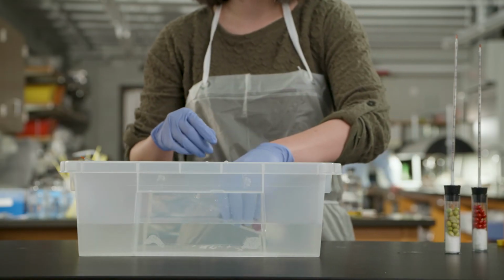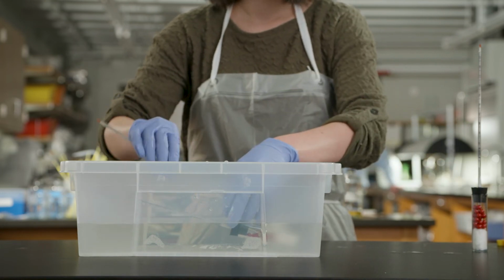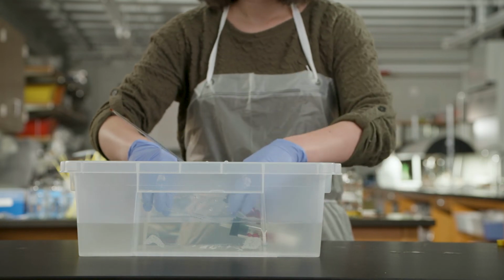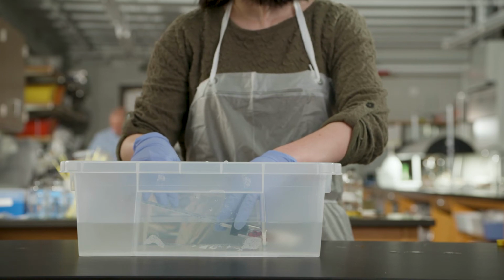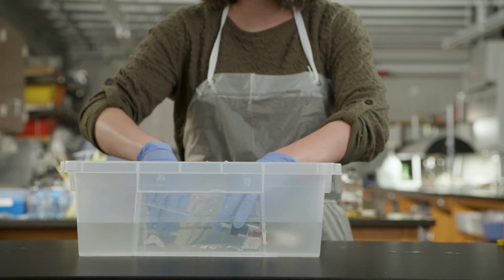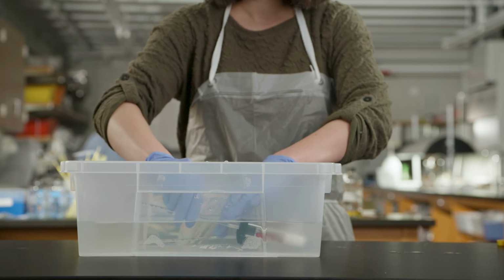Now that your respirometers are assembled, they will need to equilibrate in the water bath. Begin this process by placing the 3 respirometers into the water bath in an upright position, the pipette tips resting on the lip of the bath container. If any of the respirometer vials begin to fill with water, you must restart the experiment. After 5 minutes, submerge the respirometers in the water bath.